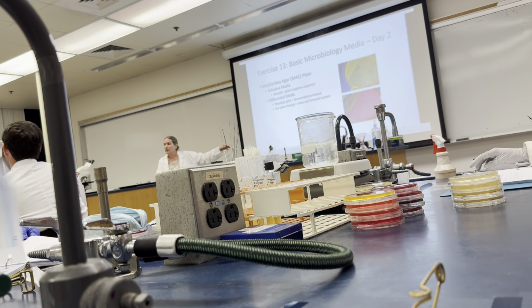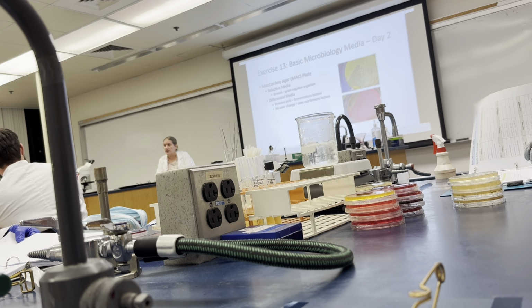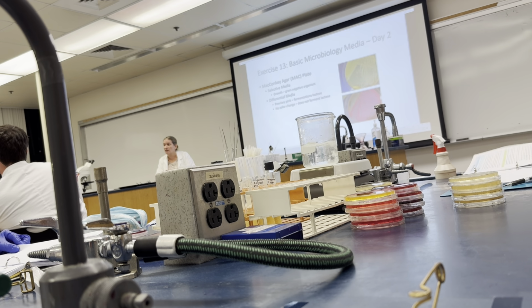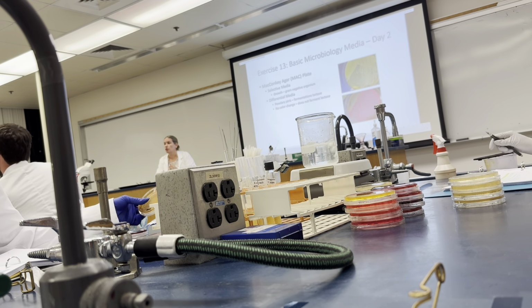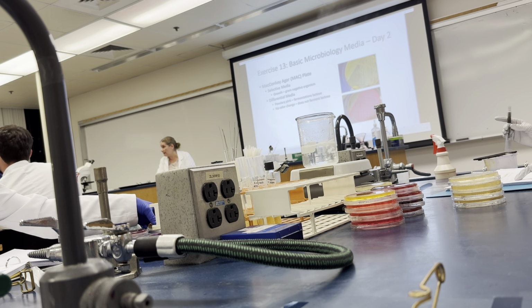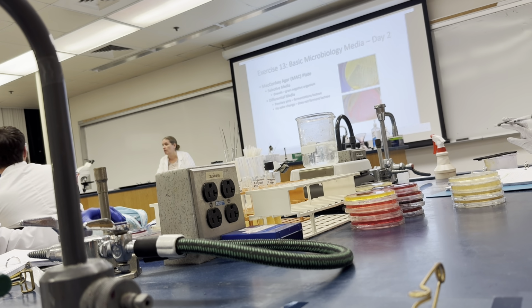This is a different test. It also is a different pH indicator. This is neutral red. Neutral red in acidic condition turns powdery pink. The appearance that you're looking for in an acidic environment is not yellow in this case. It's a different pH indicator, and if it is an acidic environment, it turns that powdery pink.